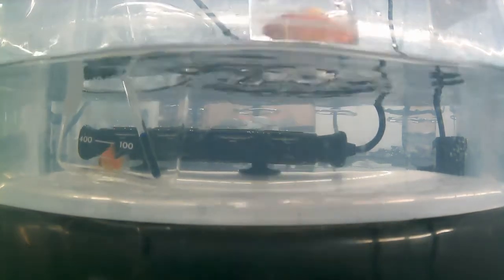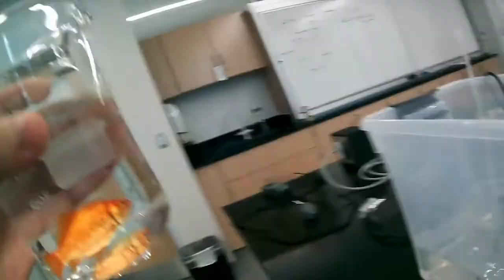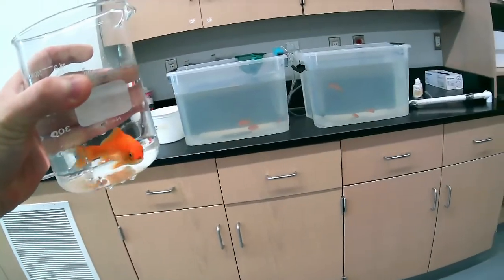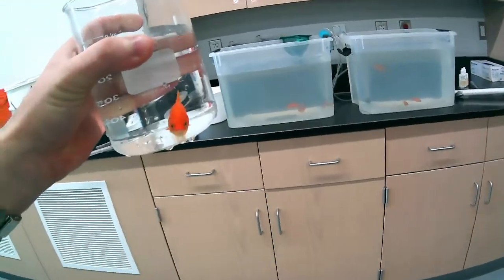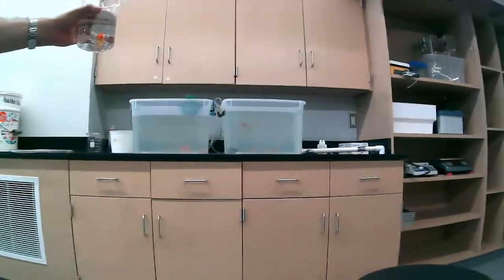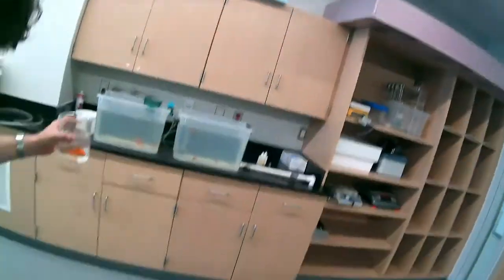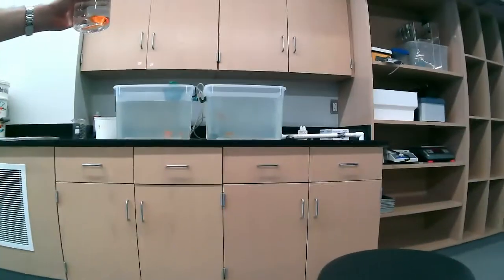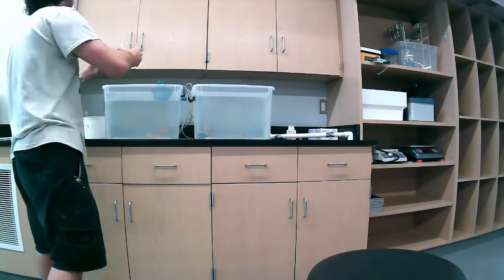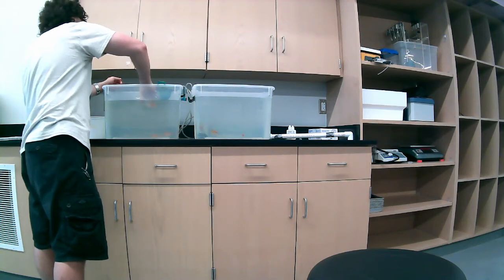And while I'm thinking of it, I'm going to show you what we do once we are done with them. So what I'm going to do, I'm just going to put him right back into the acclimation tank he was in. That's the one on the left. You're going to kind of see him do a little bit of a twirl because he's really unbalanced right now. But rest assured, he's going to be fine. If the camera will cooperate here. There we go. That'll do. So he's going to probably twirl himself down the bottom, but he will be all right again in time.